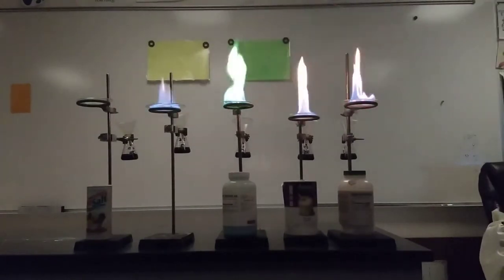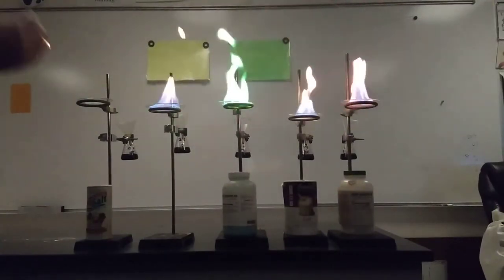Here's our control with nothing in it. We'll call that one blue. And then a little bit of purple.